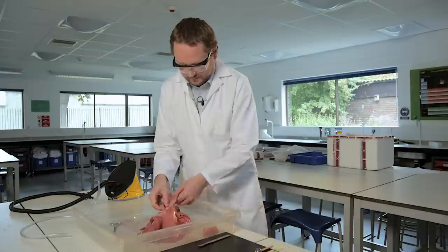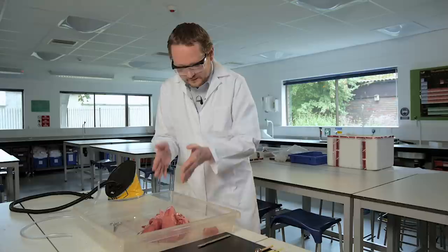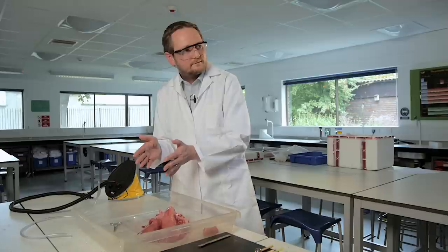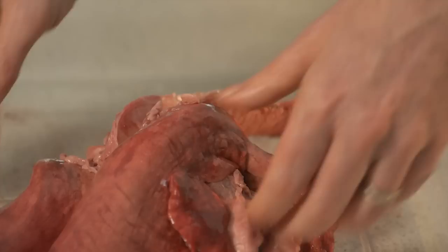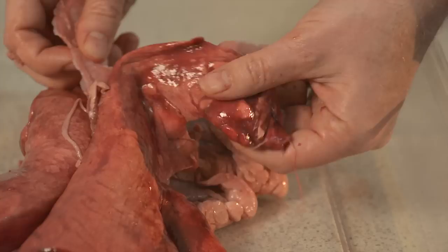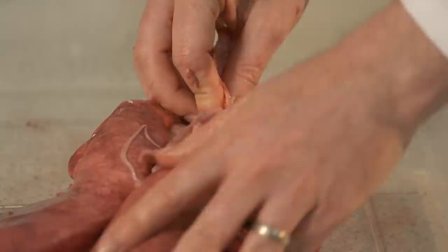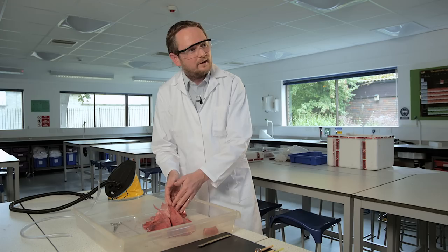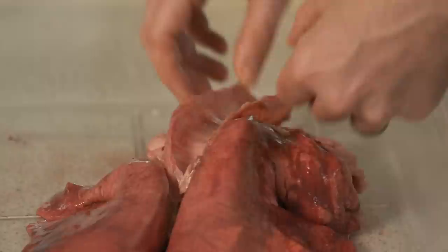For students learning biology, it doesn't really make much difference if they're never aware of that tube. But I like the idea that actually seeing real things shows students that it's not just as simple as what they see in school, in the textbooks of school. They have to be simplifications. So the lungs are split into lobes and one lung has two lobes and the other lung has three lobes. And this tube here supplies a part of this lung. By doing a small bit of inflation we can actually see which bit that tube supplies. So I think we'll give that a go.